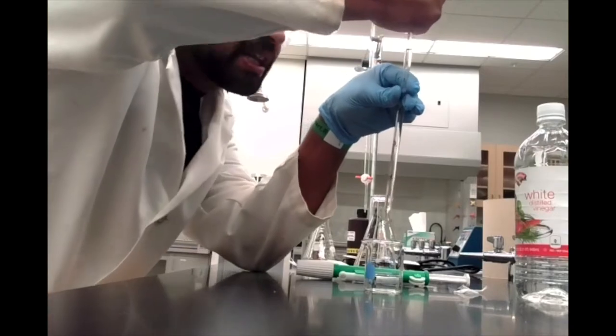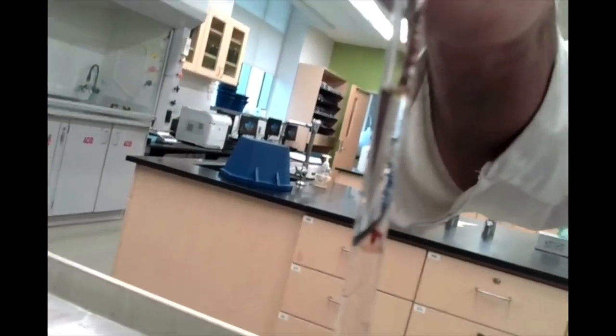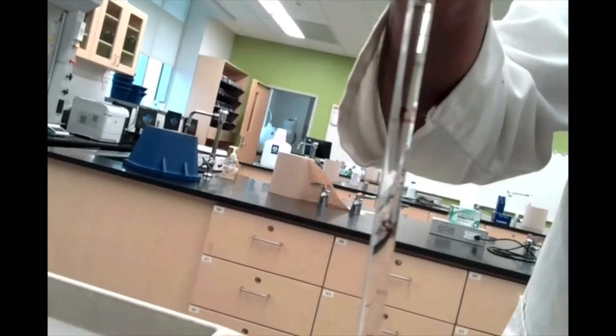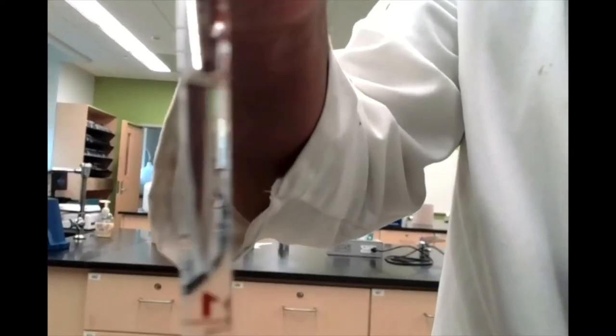There we go — I can clamp that down. Hopefully you should be able to see the lower meniscus of that marking at the zero point of the pipette. I'll then add my five milliliters to an Erlenmeyer flask by lifting my thumb. Your directions say you can add water to increase the volume, making it a little bit easier to see a reading.